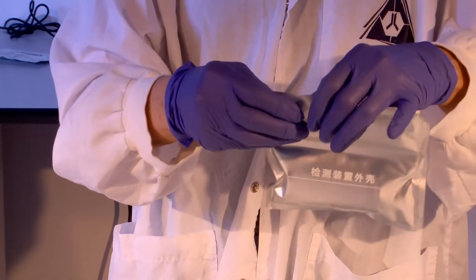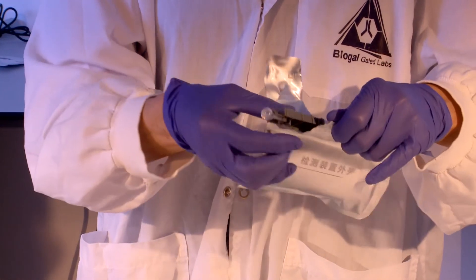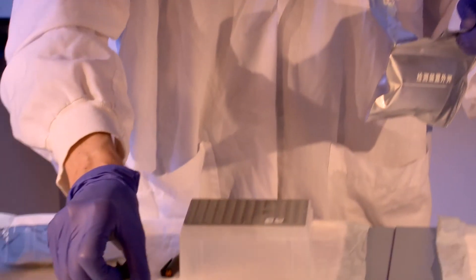One disposable nucleic acid detection device is needed for each test. Open and remove the components of the detection device.